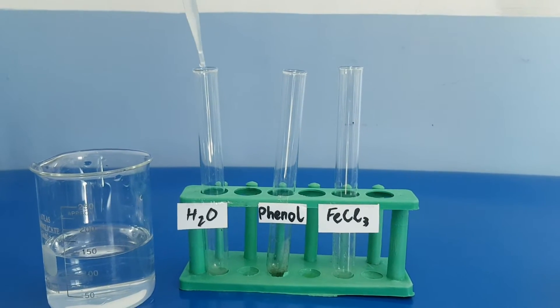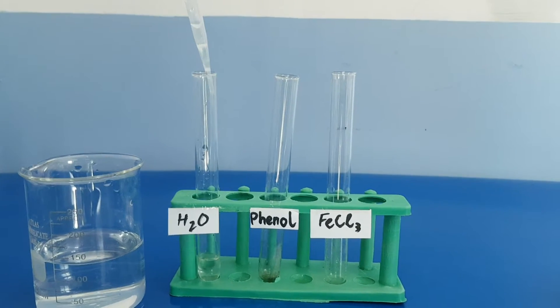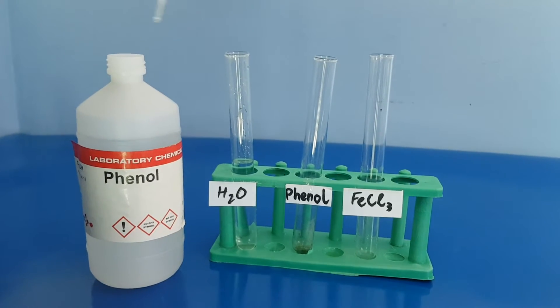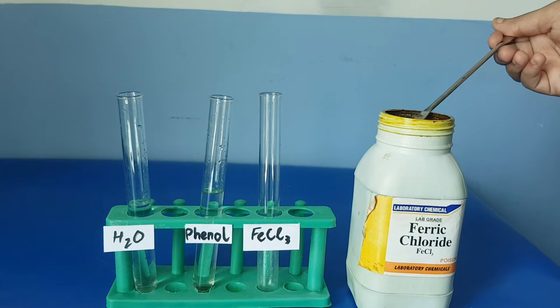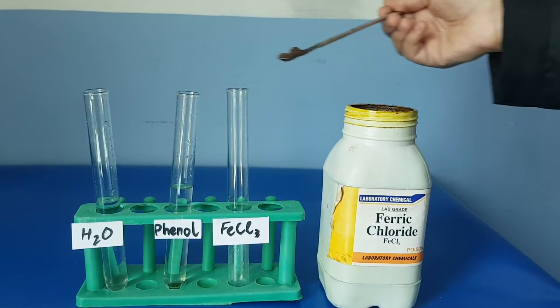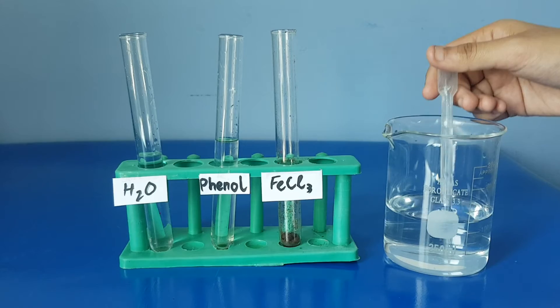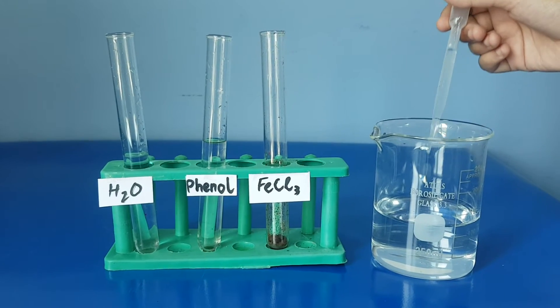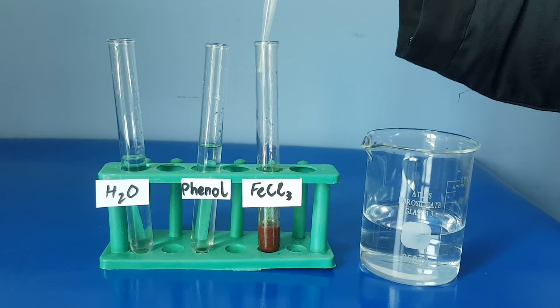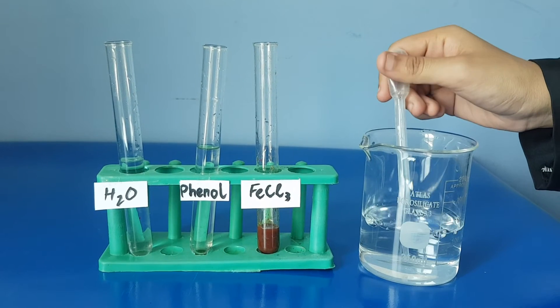Add water to the test tube. Now add phenol to the test tube. Now add ferric chloride to the test tube. As ferric chloride is in powdered form, we will add water to make its aqueous solution.